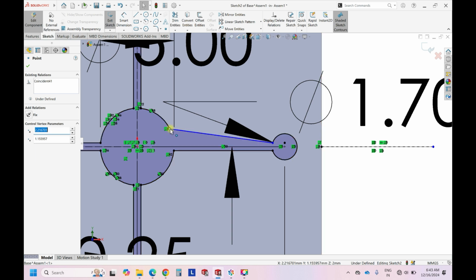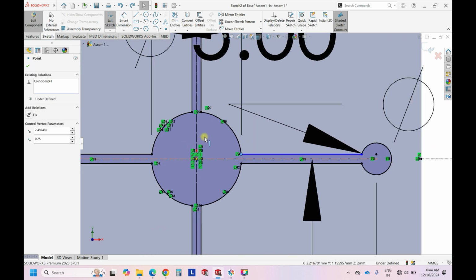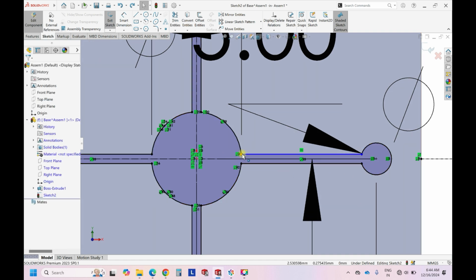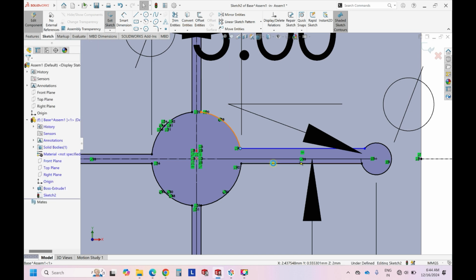So this is a major deviation that I did so that we can visualize it, but the minor deviations can happen always. So just press Ctrl Z, and now try to see that this line is not horizontal, that is the reason it is moving. So let's make it horizontal. Once you make it horizontal, now it is horizontally moving, right? So it means that it is not constrained in this axis.